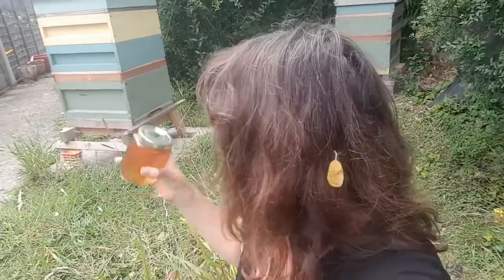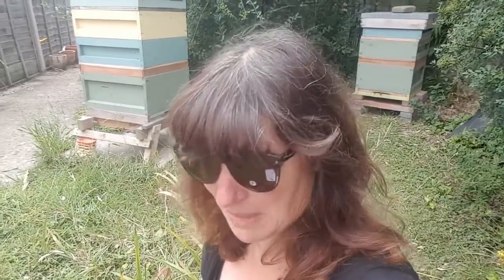Why does this matter to me? Well, I want to learn something new, and I'm curious as to what flora my bees are visiting in order to produce the honey. I've got this spring honey that I want to put under the microscope. It's from this colony here, this spring. The trouble is, I have no idea how to do it. Melissopalynology. Not one clue.